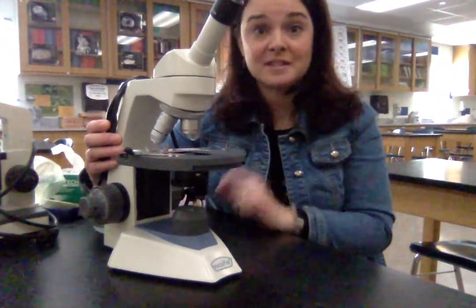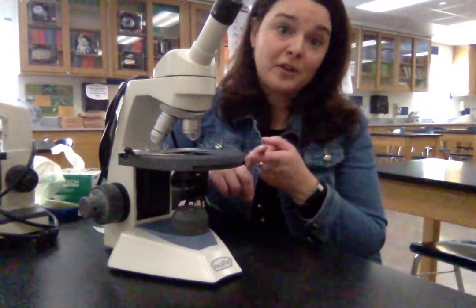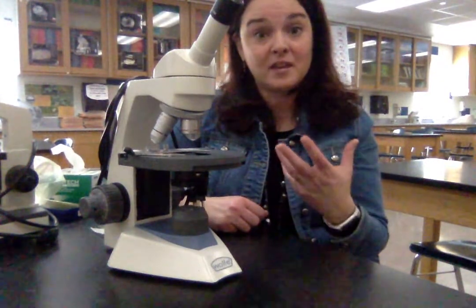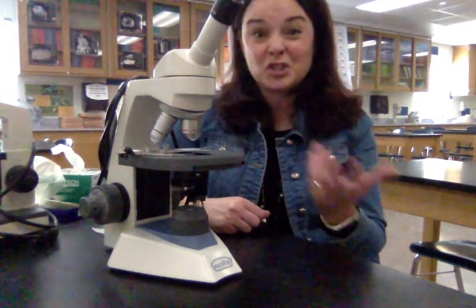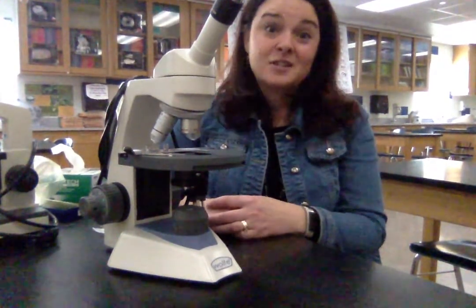If you get done with the lab early, you can look at other slides from the slide box that aren't part of the lab. I'll be bringing in an onion and setting up a station where you can actually make your own slide, stain it, and look at an onion peel under the microscope — that's pretty fun. Unfortunately this year we won't be able to do cheek cells because of germ concerns, but I can show you that as a class demo if we have time. Good luck, and email me if you have any questions or need help learning the parts of the microscope.